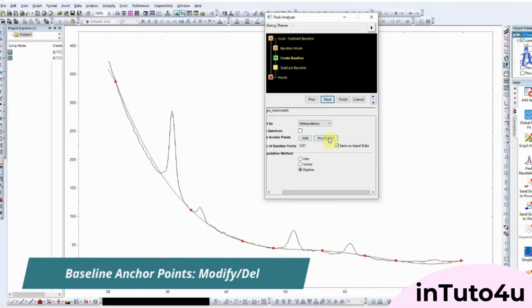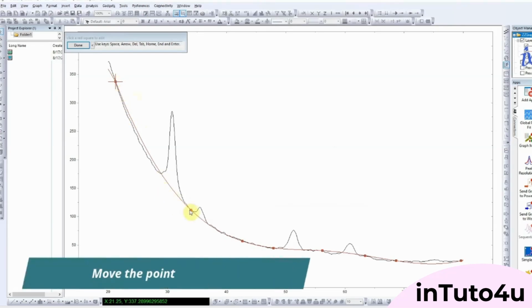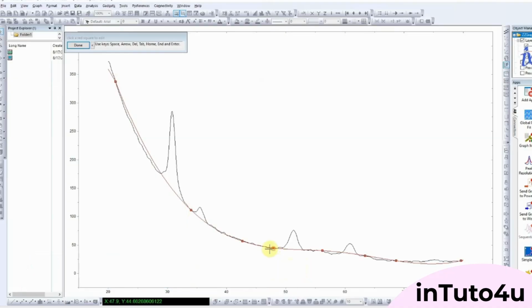On the baseline mode page, you'll see different options. By default, it may be set to Constant. Change this to User Defined. This option gives us control over how the baseline is drawn. As soon as you do this, look at the graph, you'll notice a line showing the initial baseline placement. Next, click Next to move forward.